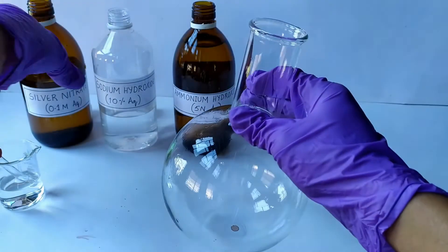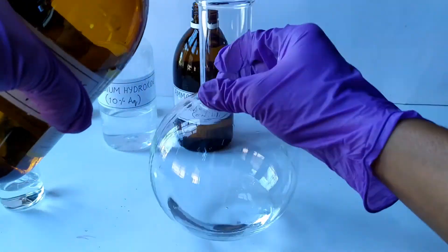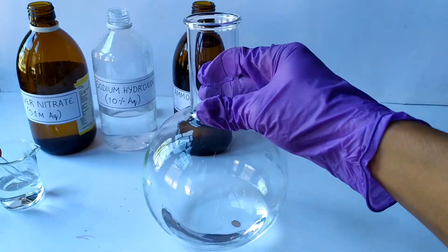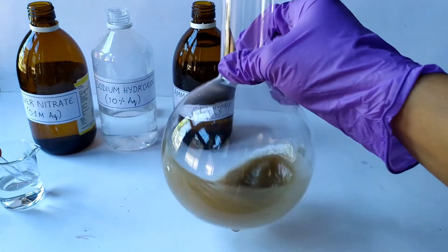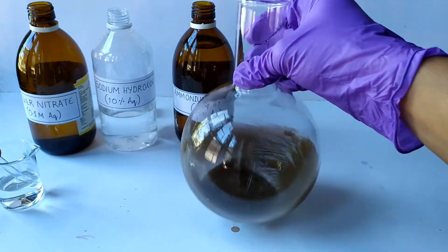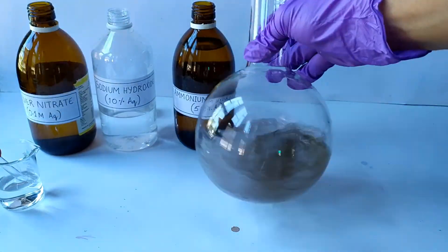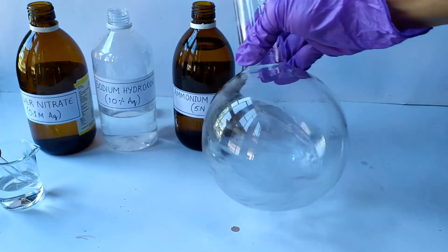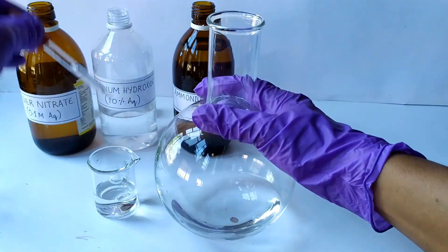On an aesthetic note, the Tollens test can also be performed using a round bottom flask as the reaction vessel. Follow the same reaction steps and you will get a visually pleasing silver mirror on the inner wall of the flask. This can be preserved as a showpiece after thoroughly washing off the reactant chemicals from the flask using distilled water.